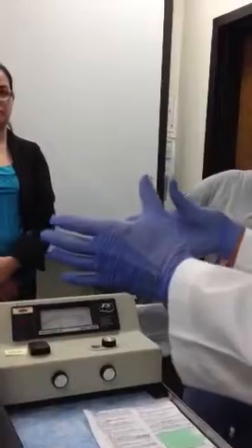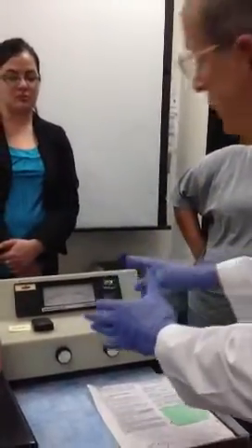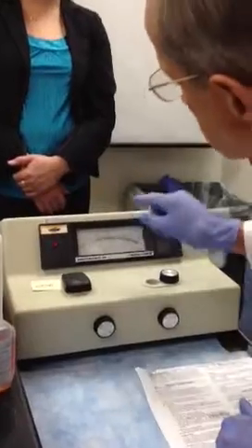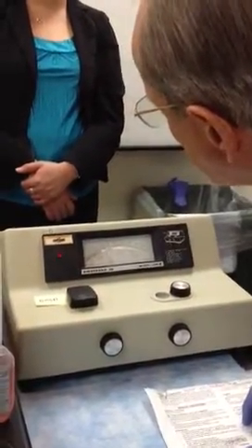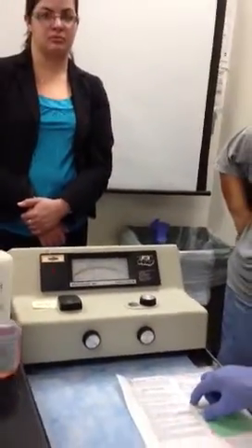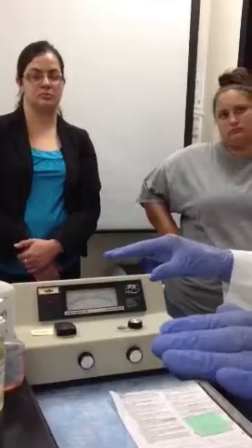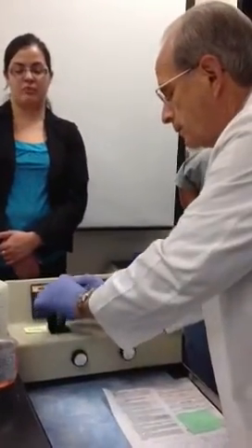We know it's 200 milligrams per 100 milliliters of cholesterol, but now we're reading down here 34% transmission of light on the top scale, and down at the bottom we're reading 0.48 absorbance or optical density. Now that's just a raw number, all right? But remember that 0.48.